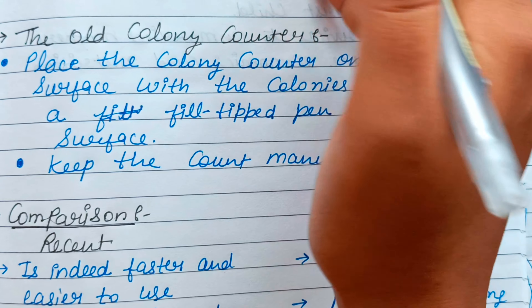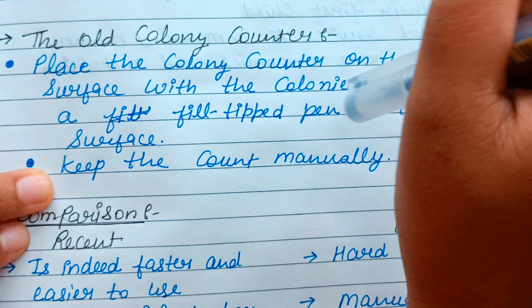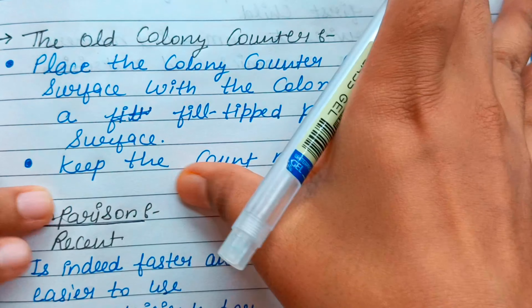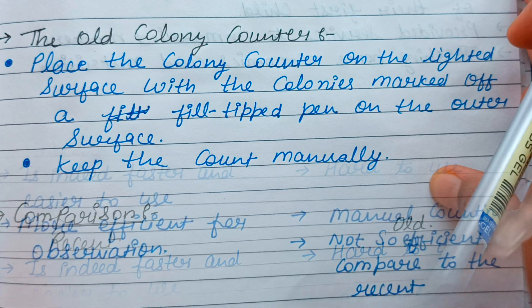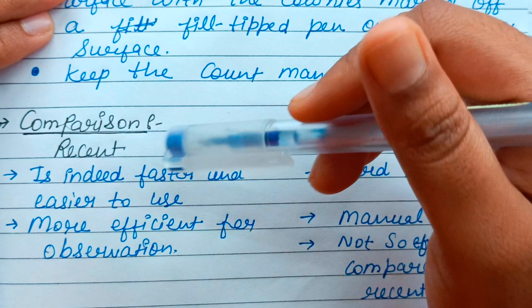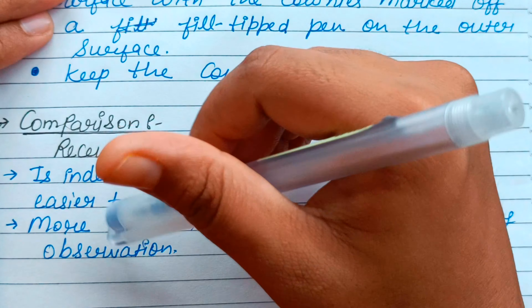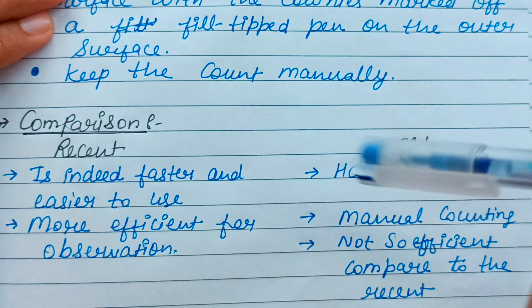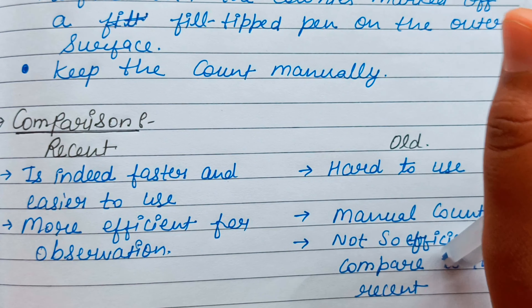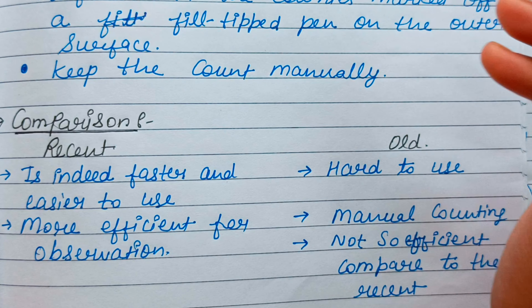Here we are comparing old and recent colony counters — their advantages and disadvantages. The old colony counter used a lighted surface with colonies marked with a felt-tipped pen on the outer surface, and the count was kept manually. The recent colony counter is faster and easier to use, more efficient for observation, whereas the old one was hard to use and required manual counting which was not efficient.